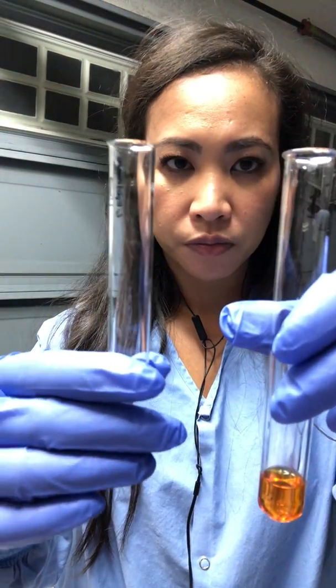After that 48-hour period, we were told to go ahead and put it in different test tubes and label it. They were labeled. And they were divided into 4 different test tubes because 2 of these were used with the Methyl Red, and the other 2 were used for the Voges-Proskauer experiment. With the Methyl Red, these were the different media that were added to it. These are the Reagents B, Methyl Red, and all that.